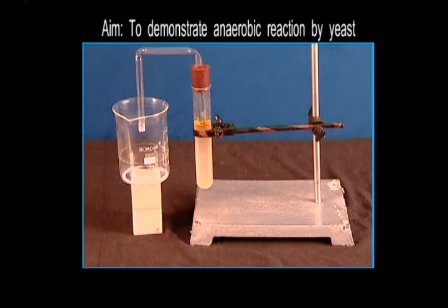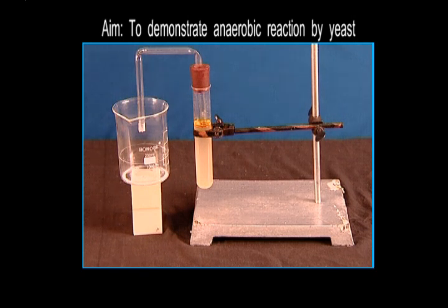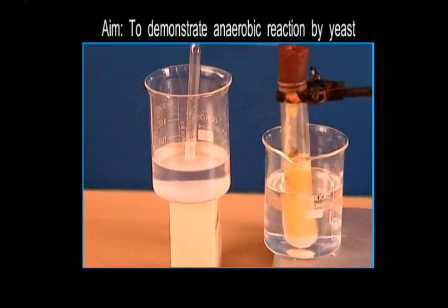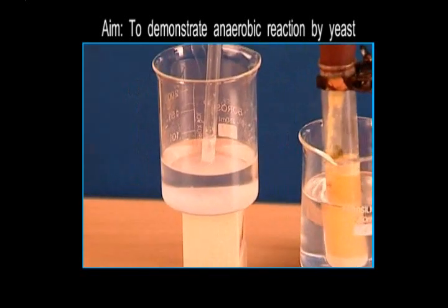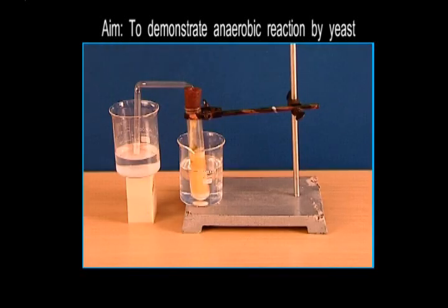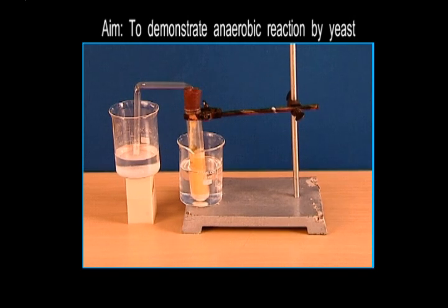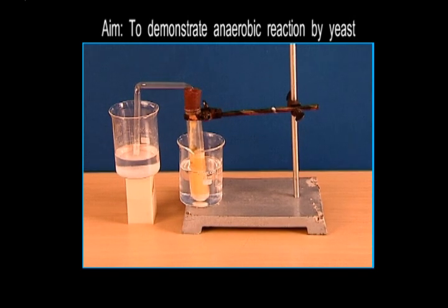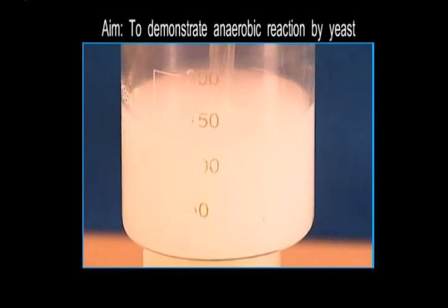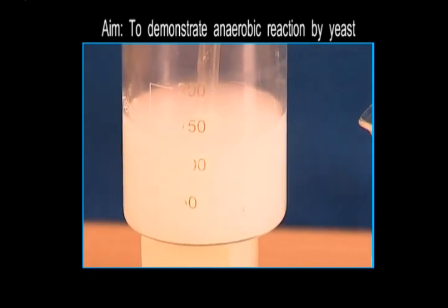One end of the tube gets dipped in the solution, as you can see here. We'll dip the other end of the tube in a beaker containing lime water. We'll keep the test tube in a beaker containing warm water and keep the setup undisturbed for some time. Observe closely what is happening — can you find the lime water turning milky?